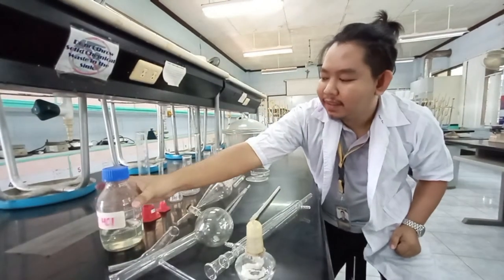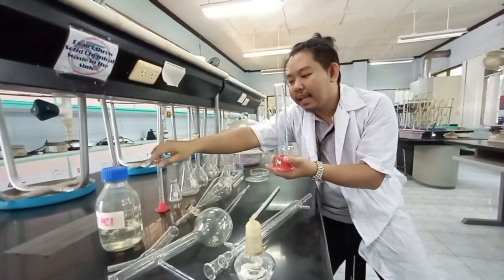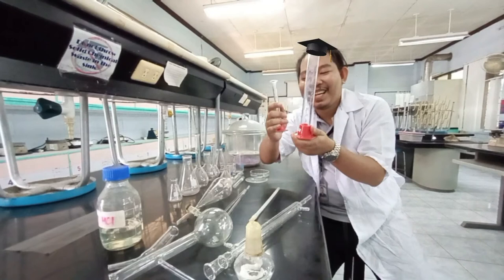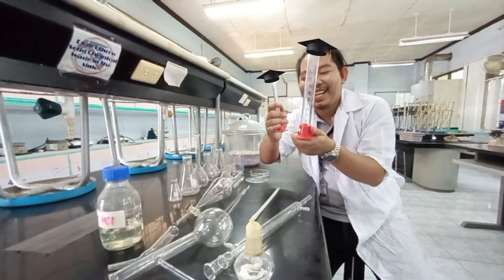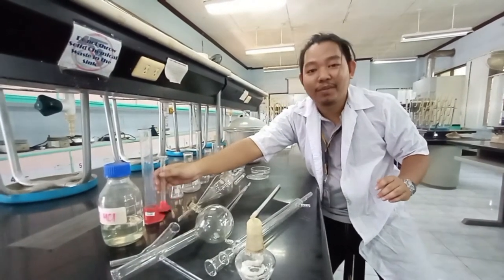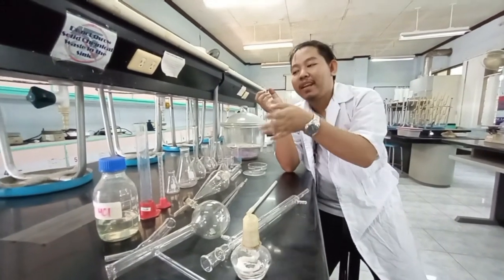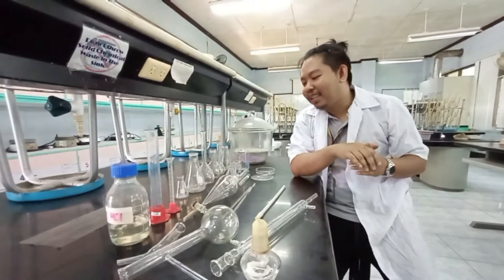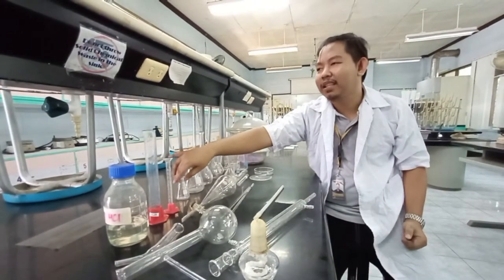Next, we have graduated cylinders in different sizes. We use these to measure the volume of liquid and irregular solids. We place some irregular solid in there, and using the Archimedes principle — or the water displacement method — we can get the volume.